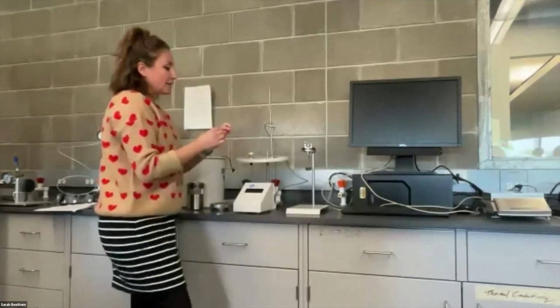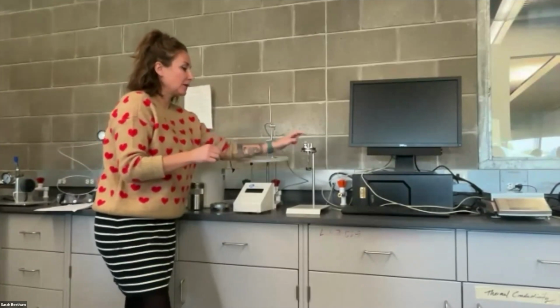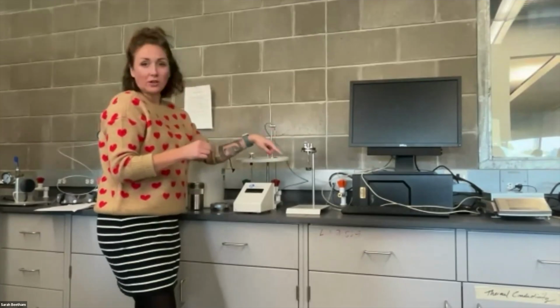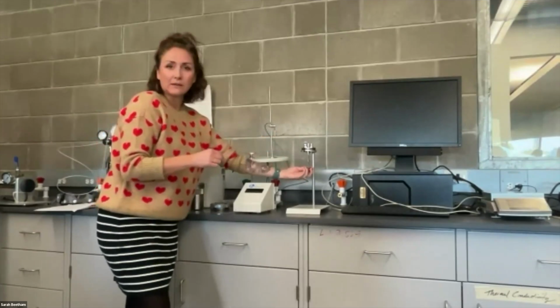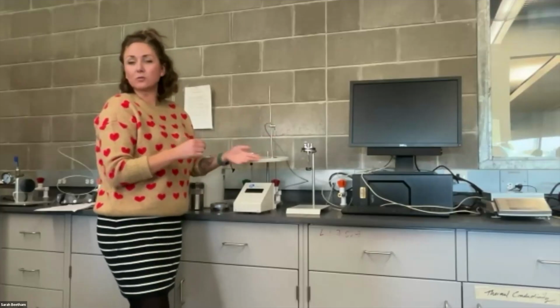And the idea here is that we want to connect the wire to both of these leads because we're gonna connect electrodes up here. And then we want the wire to be touching our food sample, but not the edge of this metal cup. If it's touching the edge of the metal cup, it'll short out on the cup and it won't actually ignite the food.